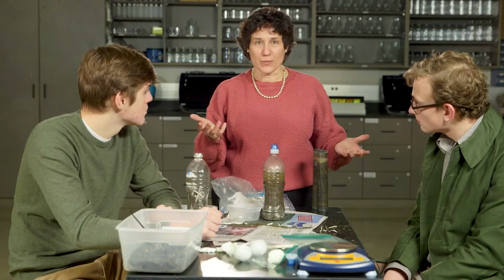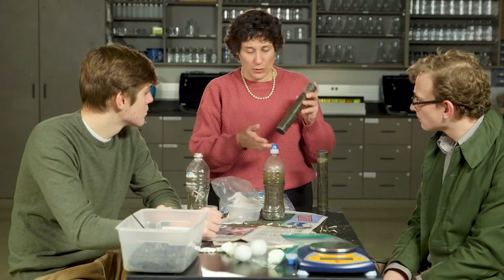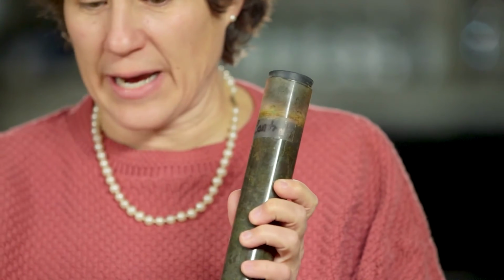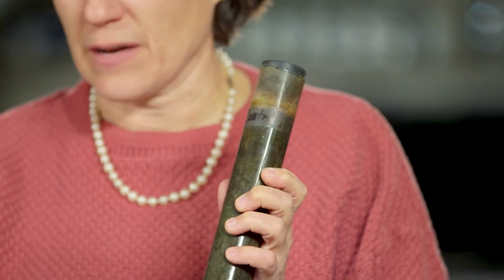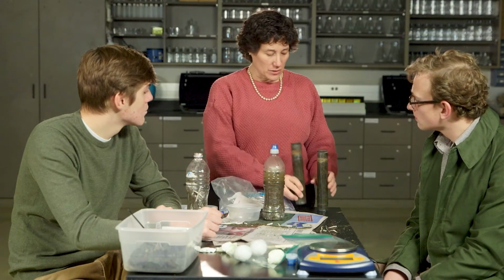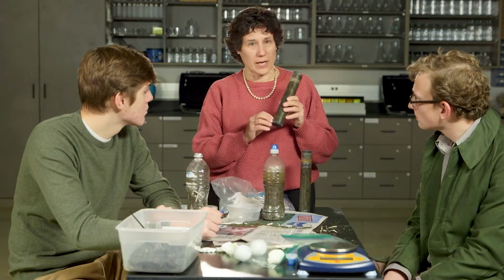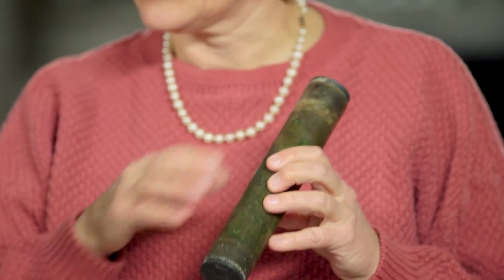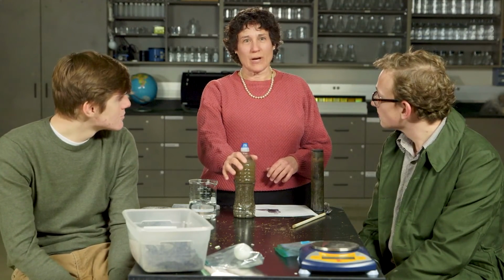You can also purchase Winogradsky columns, and Winogradsky columns are actually very similar, but they just come in a tube like this, and you can make a control that doesn't have the carbonate from the eggshell, doesn't have the sulfate from the egg yolk itself, and see what happens. And then you can have one that has both the carbonate and the sulfate in it to see if there are different changes, and you should see different bacterial activity depending on which one you're looking at. Now that you have your model environment set up, then have your students do the observations and compare and see what happens.